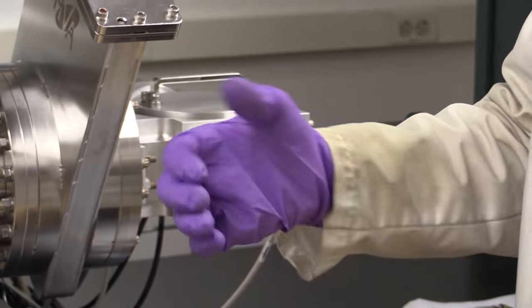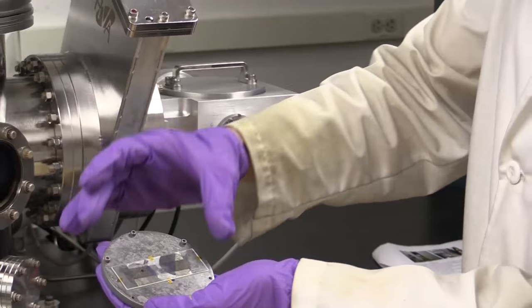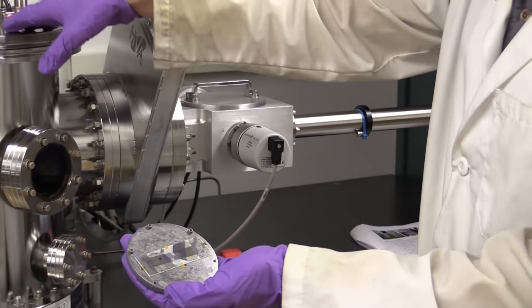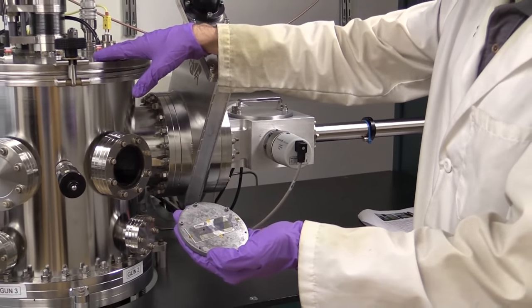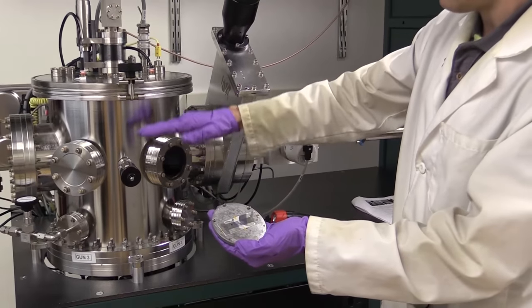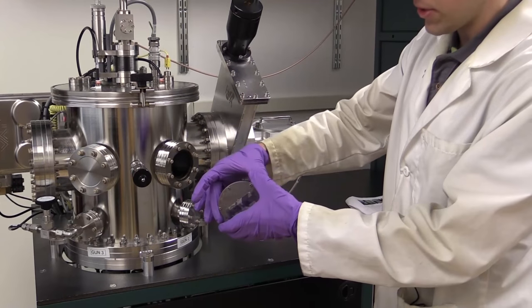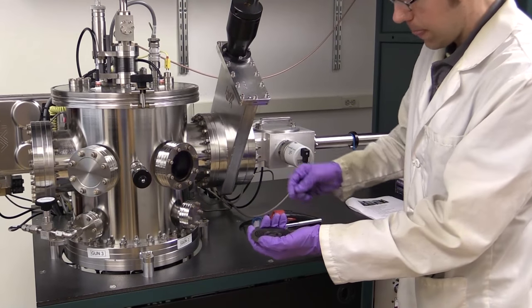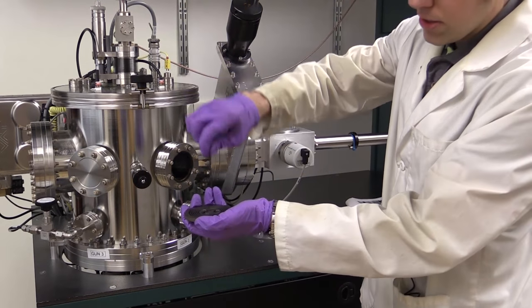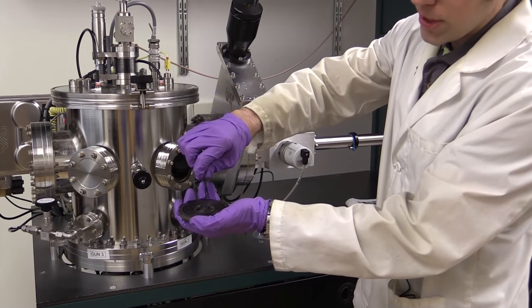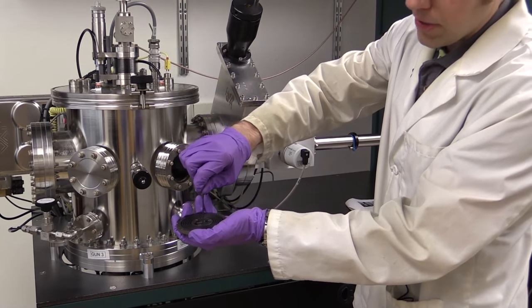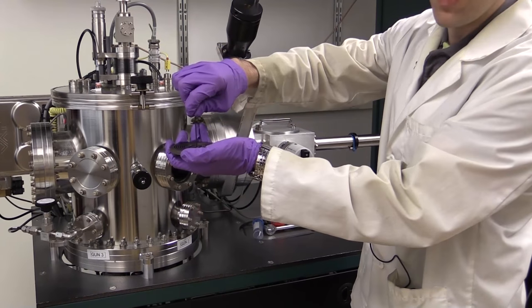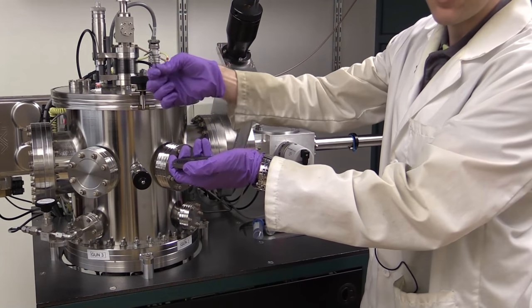Before I do that, I'd like to give a preview. When I move this substrate holder to the main chamber, I'm going to capture it with the propeller and bring it to the top. I'll invert this and demonstrate with an Allen wrench. The propeller goes down to the substrate holder, I rotate it to lock it in place, and then pick up the substrate holder.